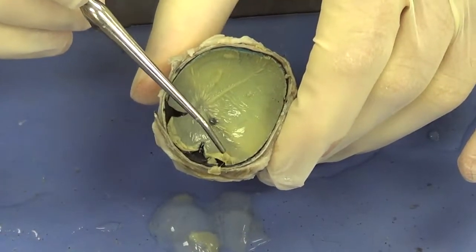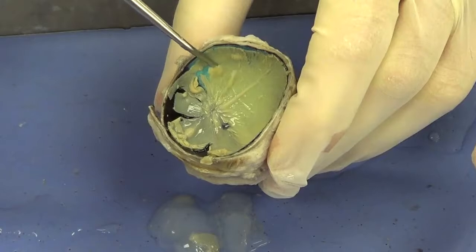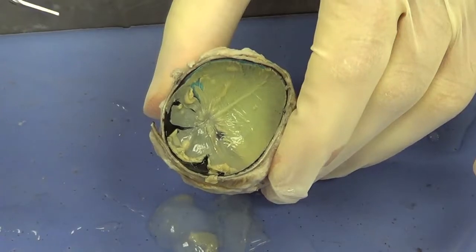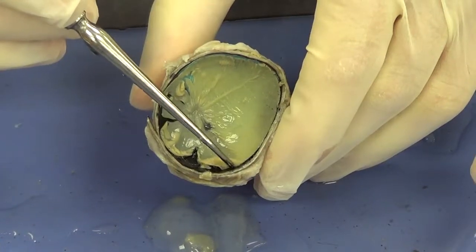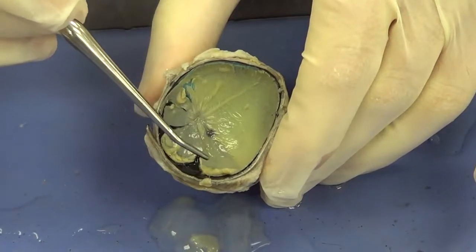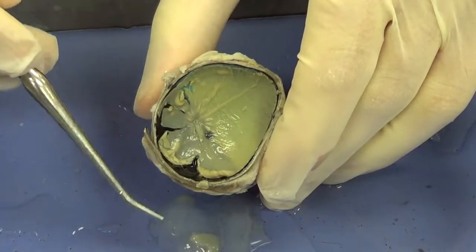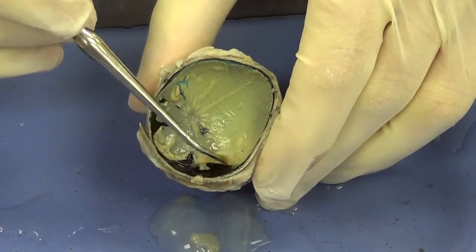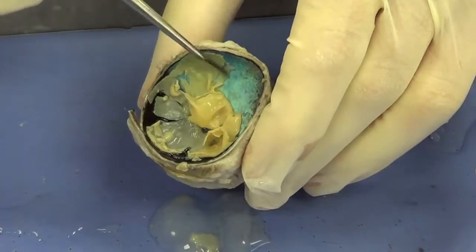Now as I move this material, as I move the retina, you can see how I'm bunching it up and moving it. It's actually going to be stuck to the eye at a certain point, right here. We'll see this in just a minute. But one of the things I want to talk about here is what keeps this retina pressed against the inside of the eye. The vitreous humor actually does. The vitreous humor is going to press that retina against the inside of the eye. And when the vitreous humor is not present anymore, I can easily take this retina and remove it and bunch it up. And you're going to see that when I bunch it up, it comes off rather easily, except in one place.